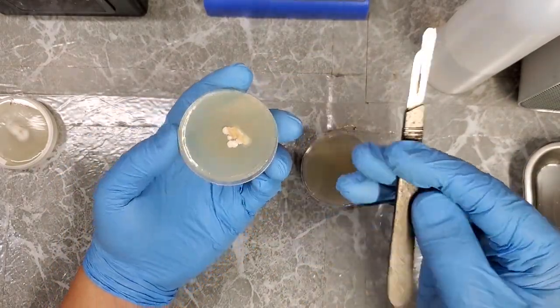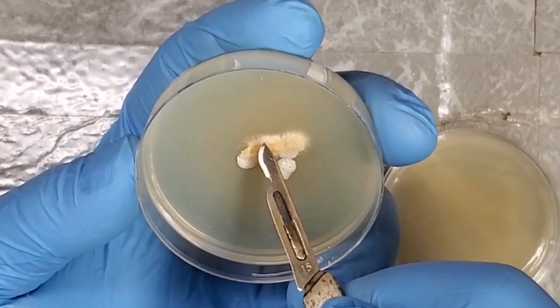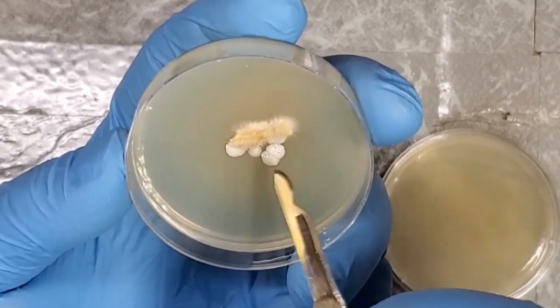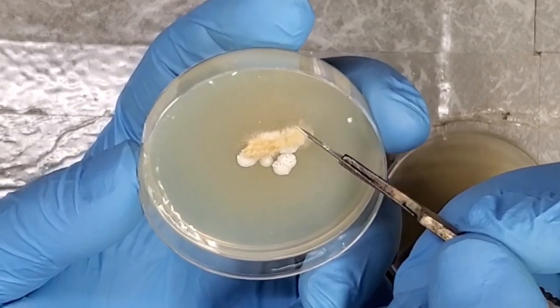You can see right here on this side, this is actually a fairly clean side of the mushroom culture itself. So over here we have all these contaminations. This right here is a perfect spot to try to do a transfer from because there's no contaminations on this side.